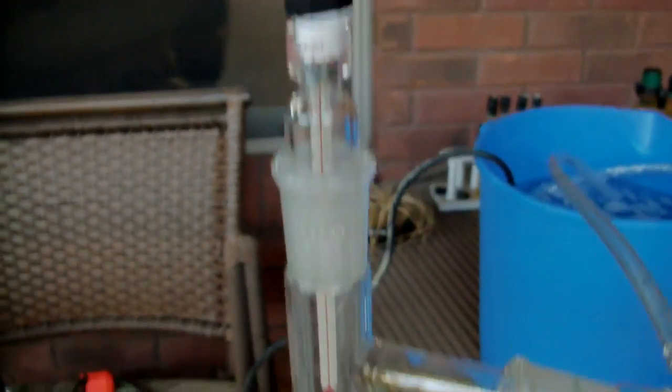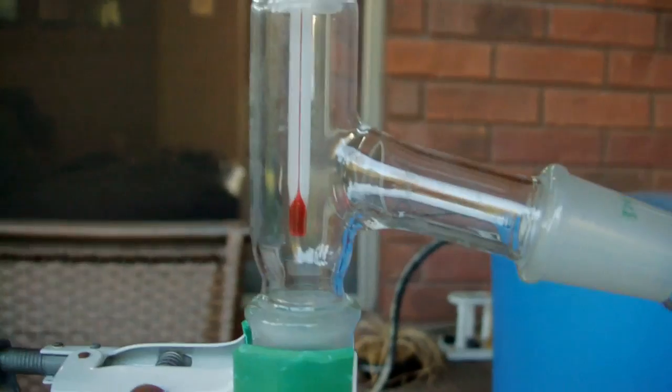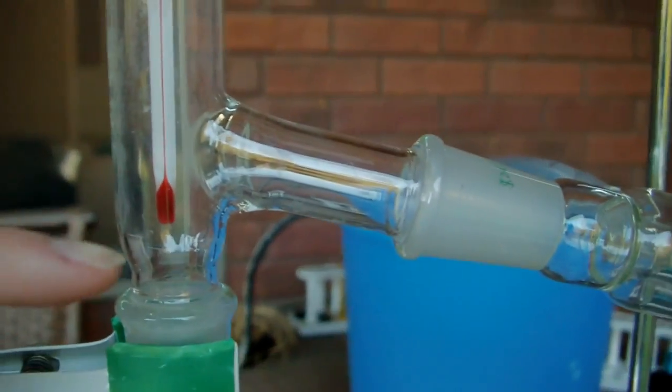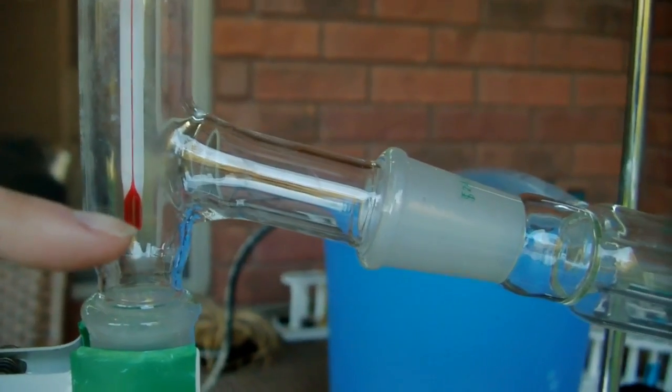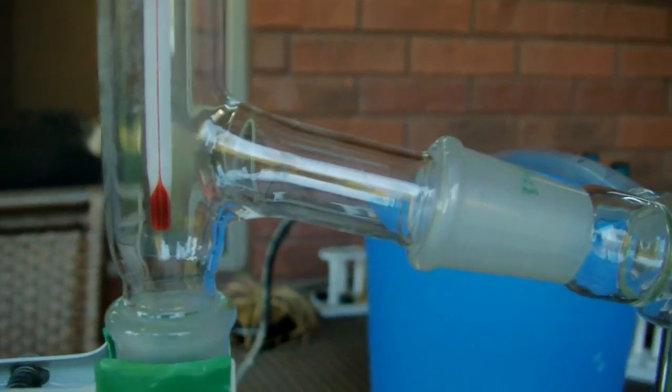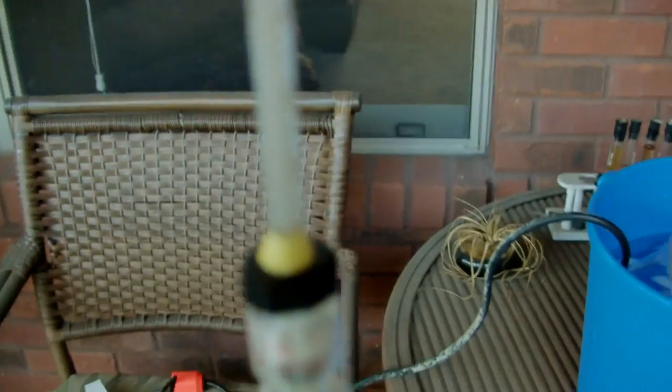And this time I have my thermometer adapter with the thermometer head positioned about even with the joint. So that's where you want the red part of the bulb, even with the joint of the adapter here, so you can get a correct reading on the vapor temperature. And so I'll just be taking a look at that as the distillation proceeds.